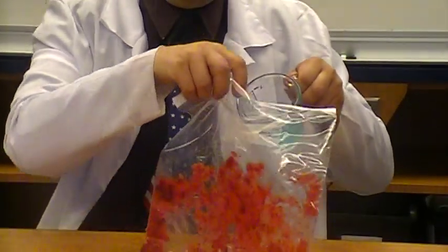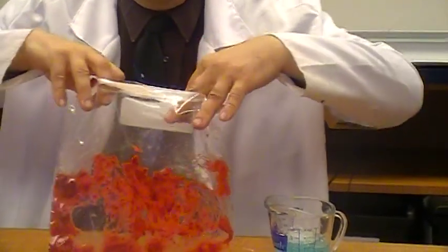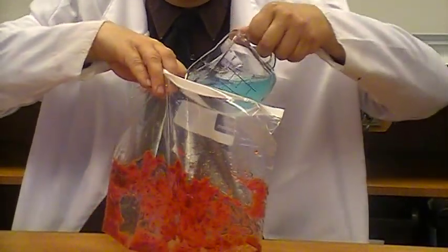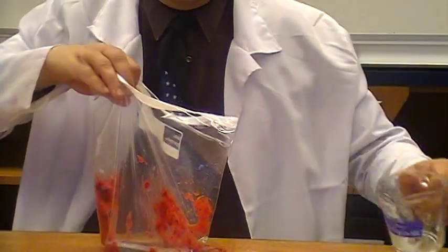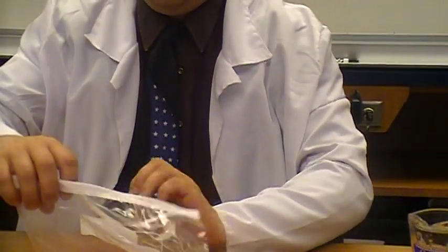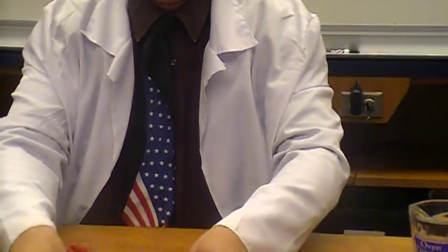And this lysis solution is what we need. This break open solution. So, I'm going to carefully pour it into the bag. Let me make a little bigger hole here. And once again, I'm going to try to remove all the air so we don't have an accident with the bag. And I'm going to start smushing it together some more.